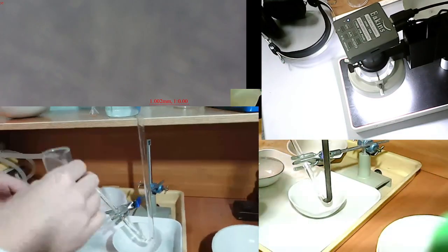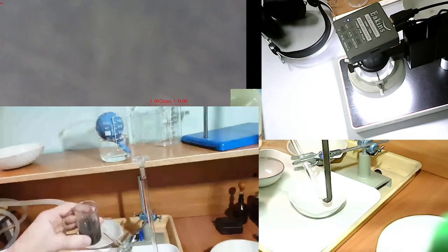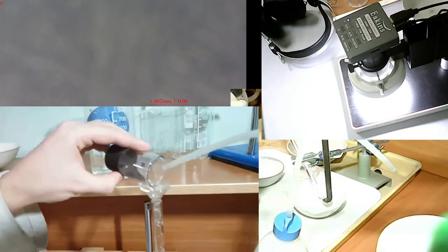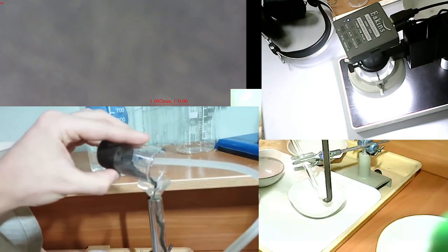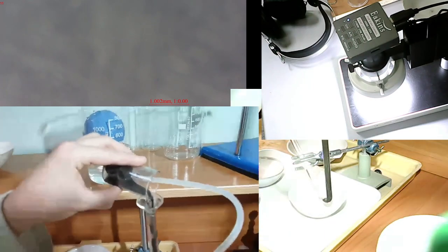So there is a special filter that captures those heavy particles. Then these filters get burned, and then we make it through hydroseparation and get those heavy particles that are sometimes between a few microns to 100 microns.